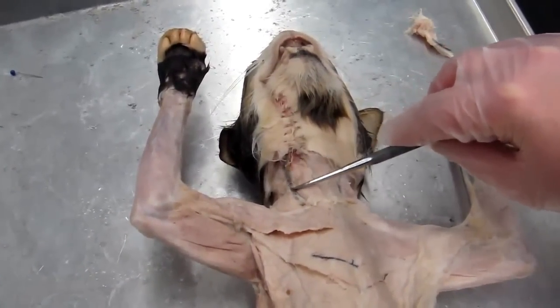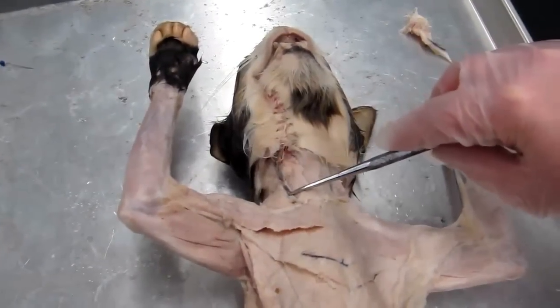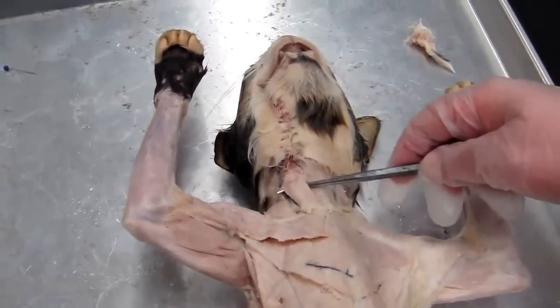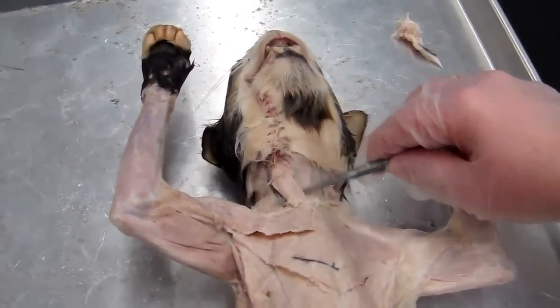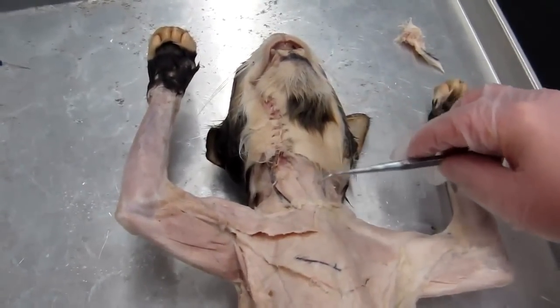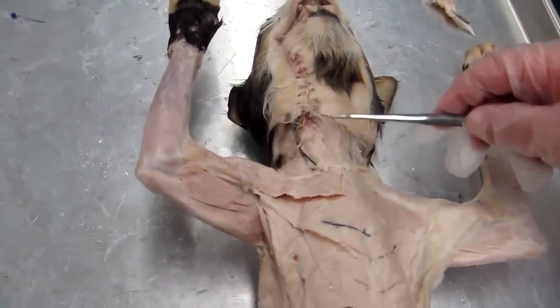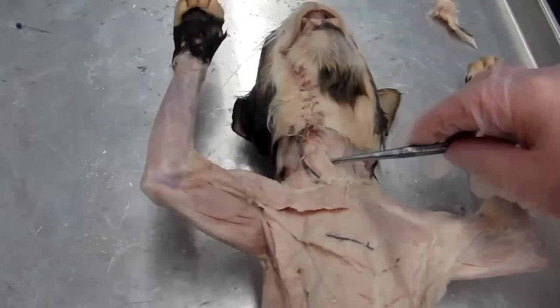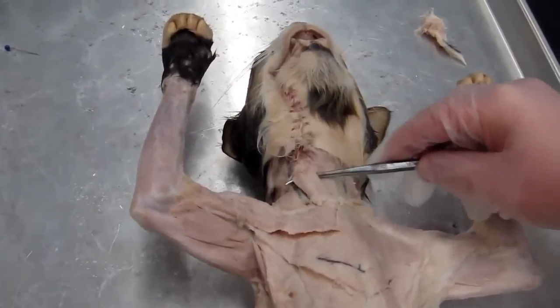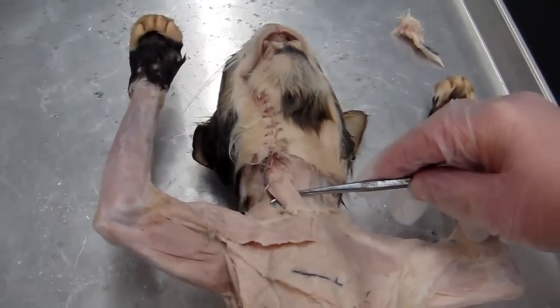It may be blue in your cat as you've been dissecting it. This is the external jugular vein. Okay, so that's a very good landmark to be looking at for this. Okay, so this particular muscle, when it's working with its companion on the opposite side, is responsible for flexion of the neck, and working as an individual muscle, it would give us rotation of the head.